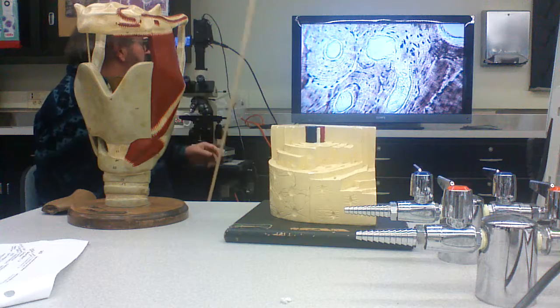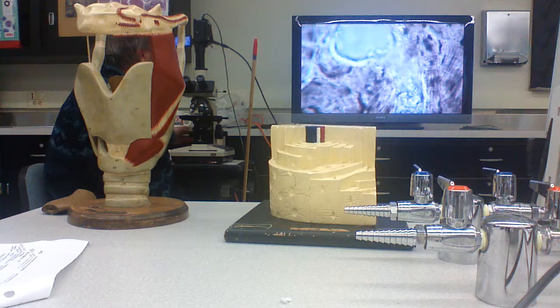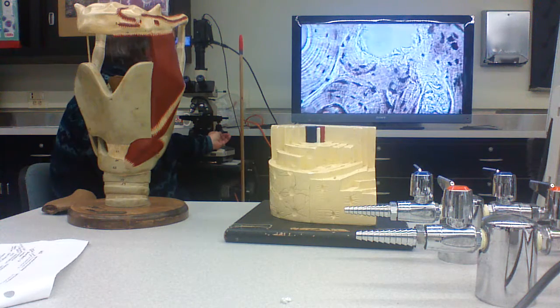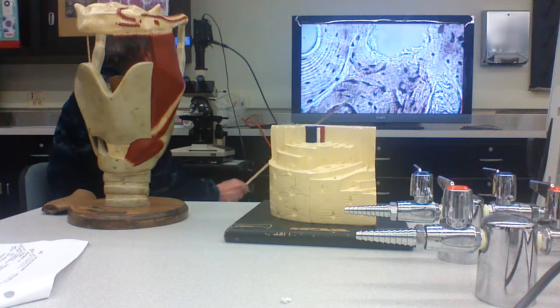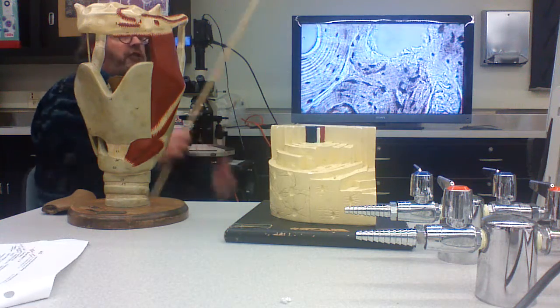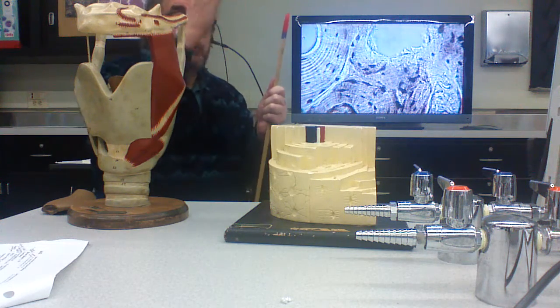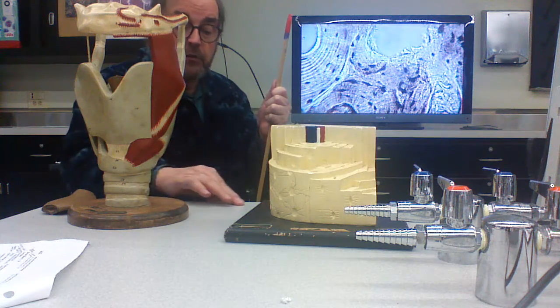Now, one of the things that Nick mentioned were the canaliculi. So I'm going to go up in magnification. And again, these are not cells. They are essentially the lacunae of cells, osteocytes. Here they are. And the black stuff, which oftentimes is in the canals, is simply the grinding grit and debris. You cut a slice of bone, as thin as you can, and then you grind it.